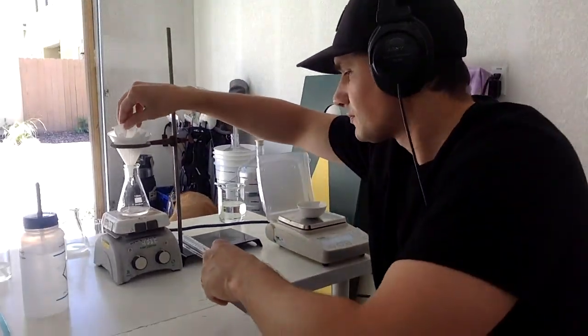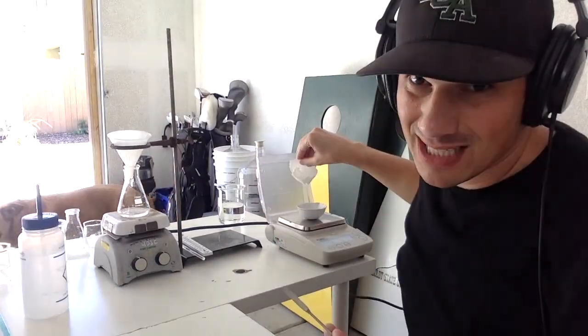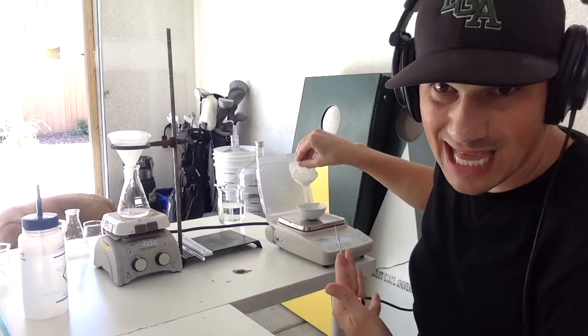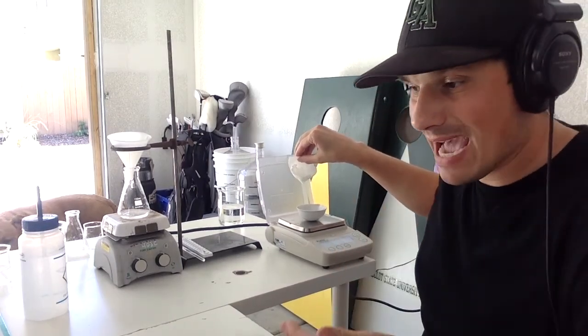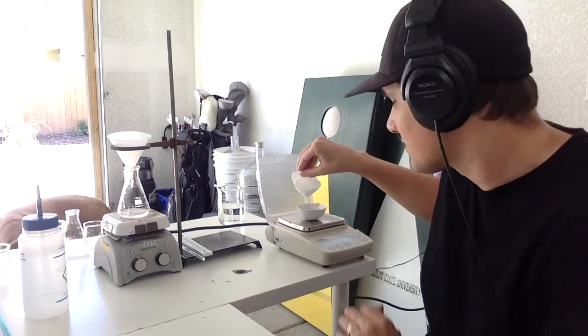All right, guys. What up? We're back. It's another day. I waited way more than 2 hours, but I just wanted them to be perfectly dry before I measured out how much aspirin that we made. So that's what we're gonna do right now. We're gonna take this funnel out. Got my spatula, and I'm gonna scrape directly into the evaporating dish because I already have it on my balance. So I'm gonna get that mass there, and then we're gonna see the mass with the evaporating dish and the aspirin to do a subtraction by difference.